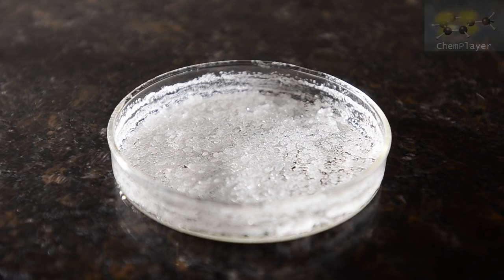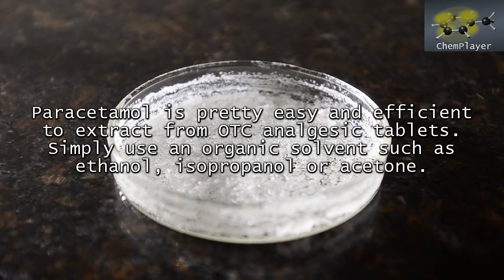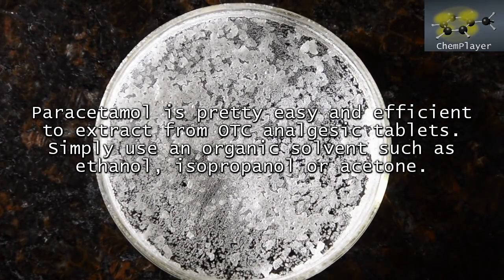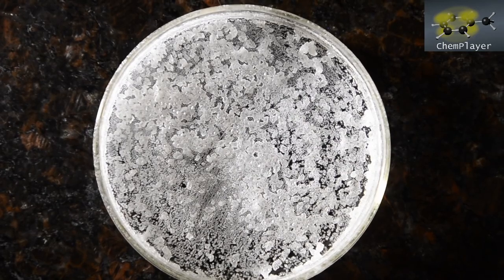We've shown you in the previous video how it's quite easy to extract pure paracetamol from tablets using an organic solvent such as acetone, ethanol or isopropanol.